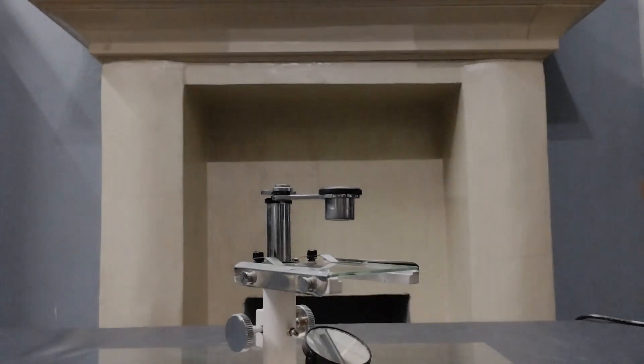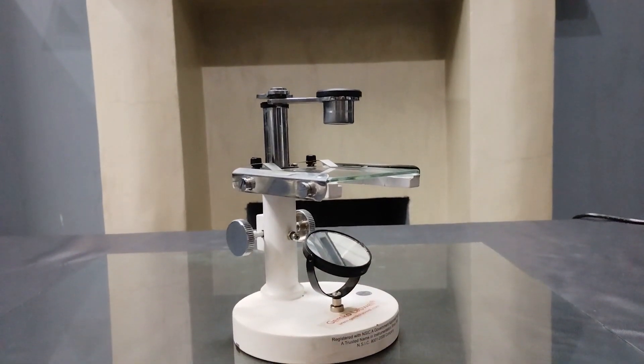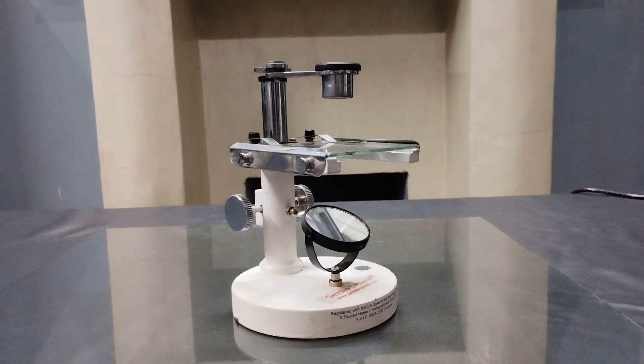Hello and welcome to a new episode on the subject of microscopy. This is a quick tutorial video on how to use a simple dissecting microscope.